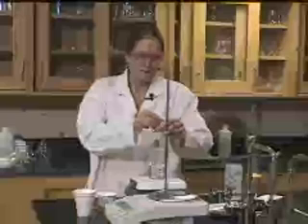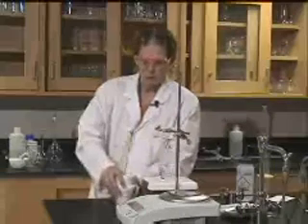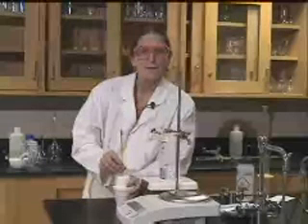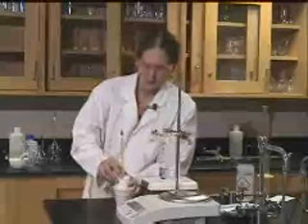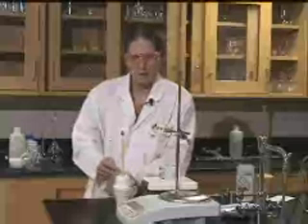and I'm going to take my sample, and I'm going to quickly put it in the water. Put the top on, swirl it around, and we're going to swirl the cadmium metal in the water with a thermometer to try to make sure that we get uniform temperature. We'll read our thermometer, and when it stops changing, we'll record that temperature. The temperature is 24.5.